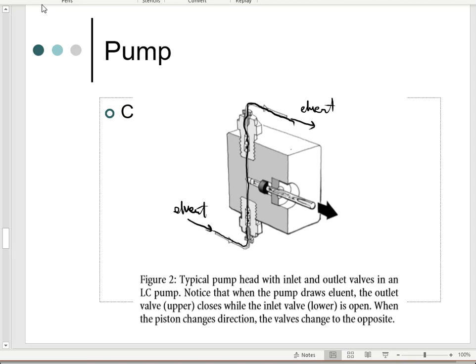Well, in order for that sucking action and that flow to happen, this pump has to have a piston, and this thing will go back and forth. So this is the metal bar that you saw them unscrew to get to the pump seals, and this thing goes back and forth, back and forth, and it sounds like a squeaky little rocking chair, or a porch swing that's kind of rusted. That's the noise you're going to get from it, and that rocking motion helps push the mobile phase through the system. So it's very important that these things stay clean, that way nothing's going to gunk up around the outsides of them and prevent that motion or that flow from happening.